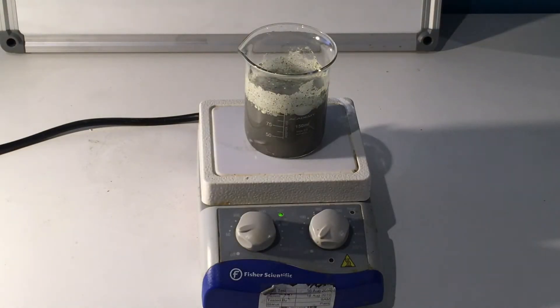I have noticed that the iron at the bottom should be reacting with the citric acid that I've added to try and get rid of it, because the citric acid will react with the iron but not with the iron sulfide. Any iron should be collecting on the stir bar because it's magnetic, which may be a problem, but it should all react with the citric acid.